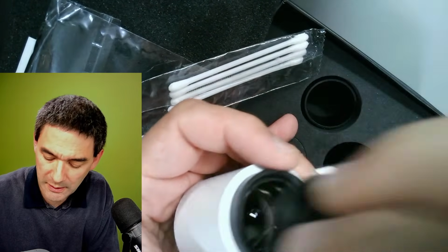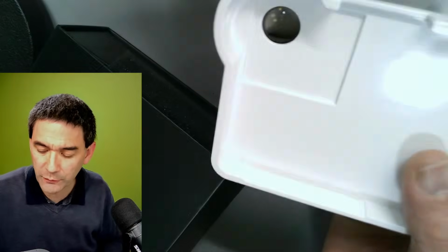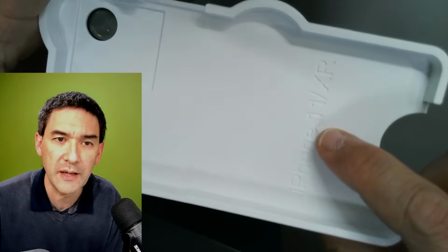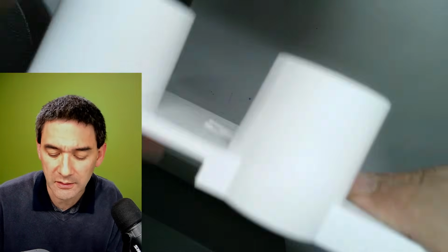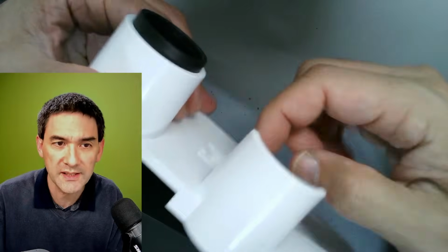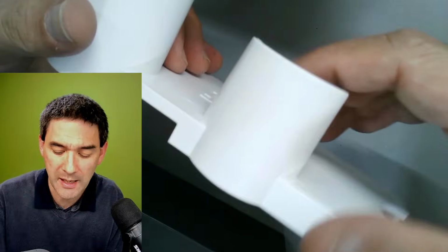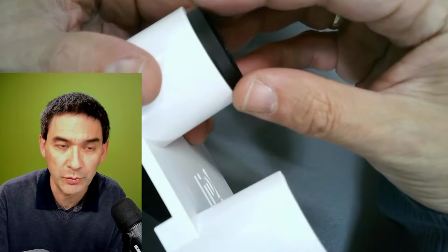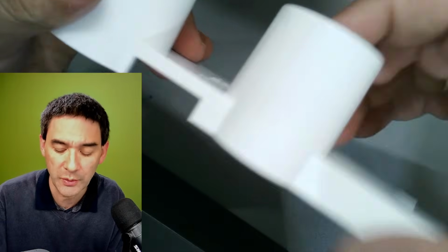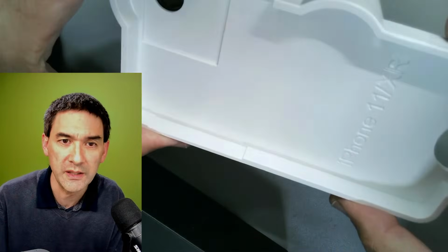Okay. And there is actually a lens in here, optics. And the interesting thing is, of course, it fits exactly into the iPhone. So there is no adjustment necessary, and look, this is what I kind of like. It rests on both eyepieces. If you've got a binocular microscope, then it holds the mobile phone horizontally, because this one goes in one eyepiece and this one simply rests on the other one. So you can look at it with a real screen.